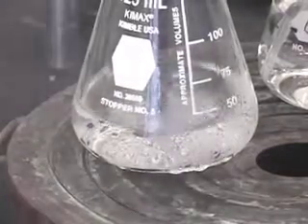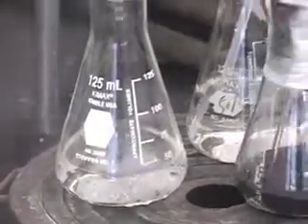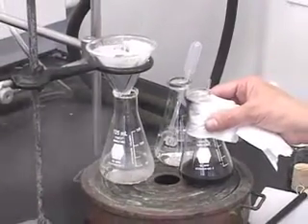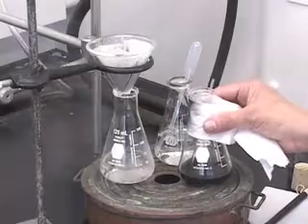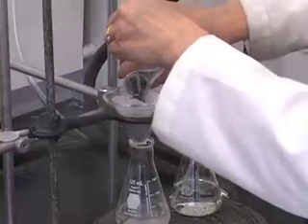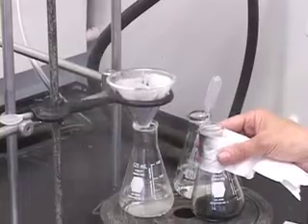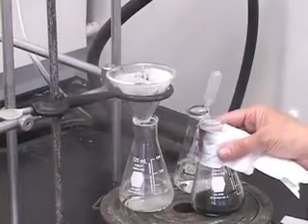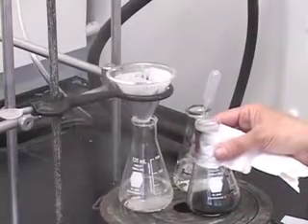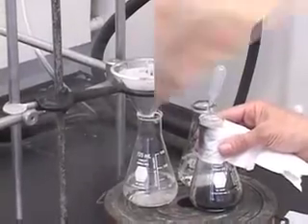And in between, while it is filtering, you want to keep this solution hot. So hold it right on the steam bath to make sure that it stays hot. And then pour, bring it back to the steam bath, continue till everything is filtered. And then once all of this is filtered, we will rinse the flask a couple of times with the hot solvent to ensure no product is lost.